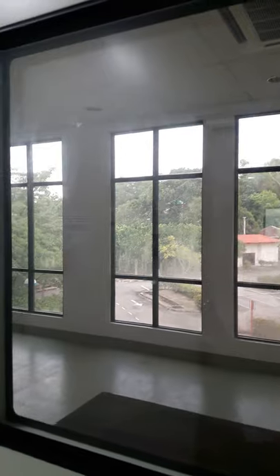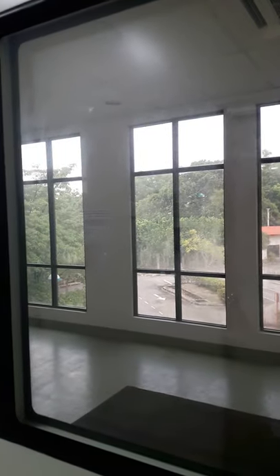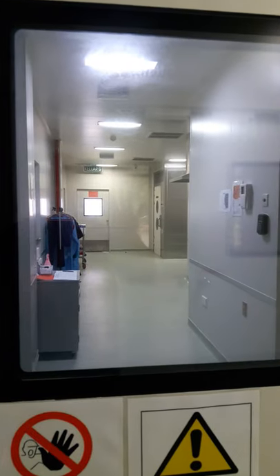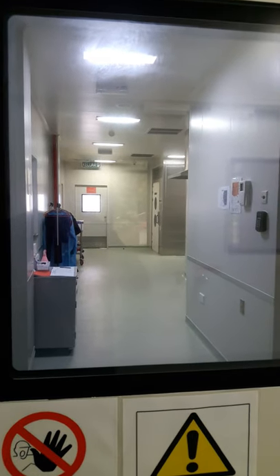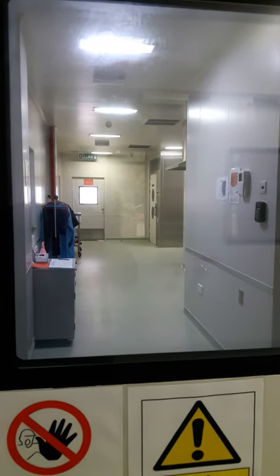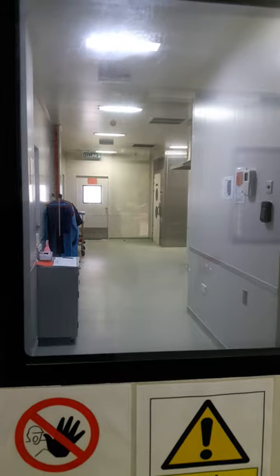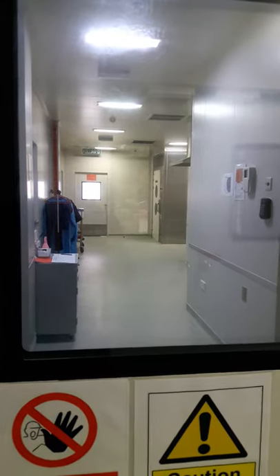So if you follow the video, on this side is the external environment, and on this side is basically the area which is under containment.